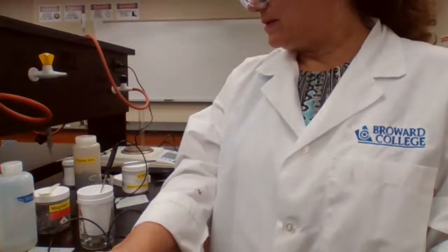So 38.4, still going up, so I'm just going to wait for a minute.